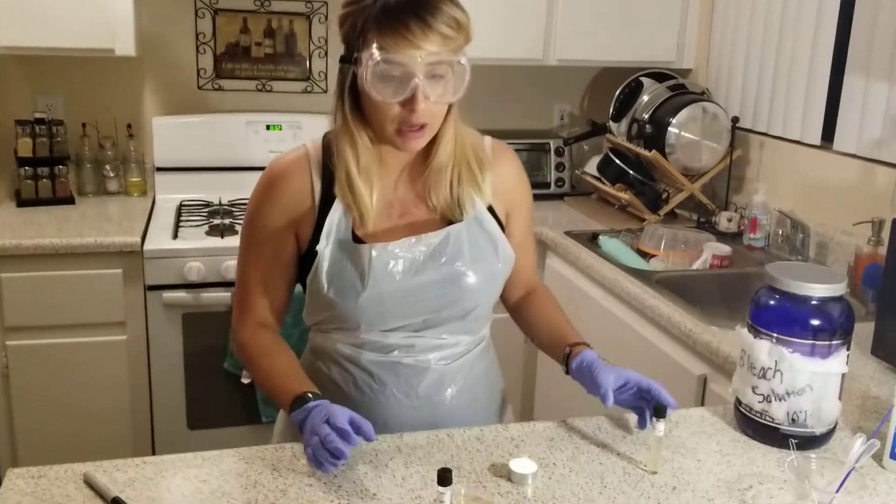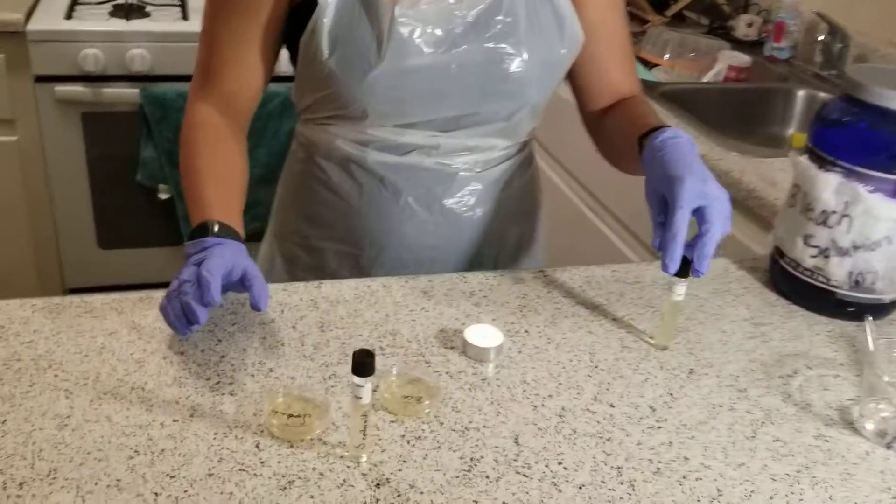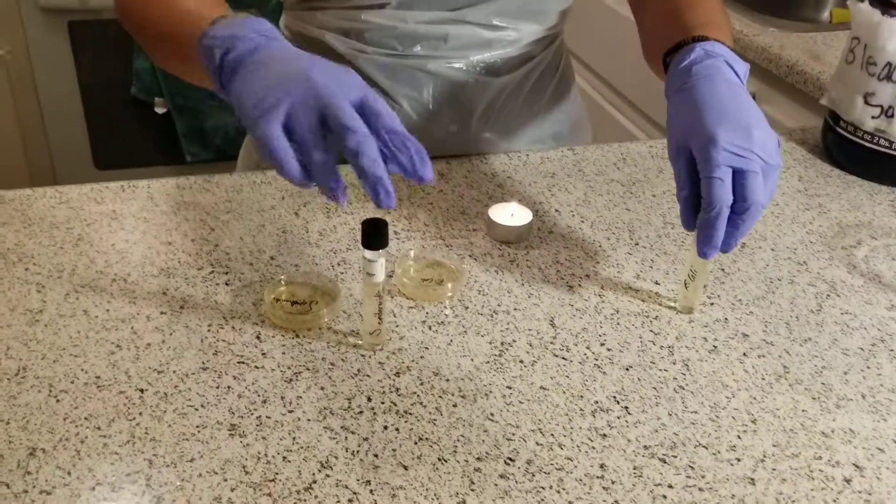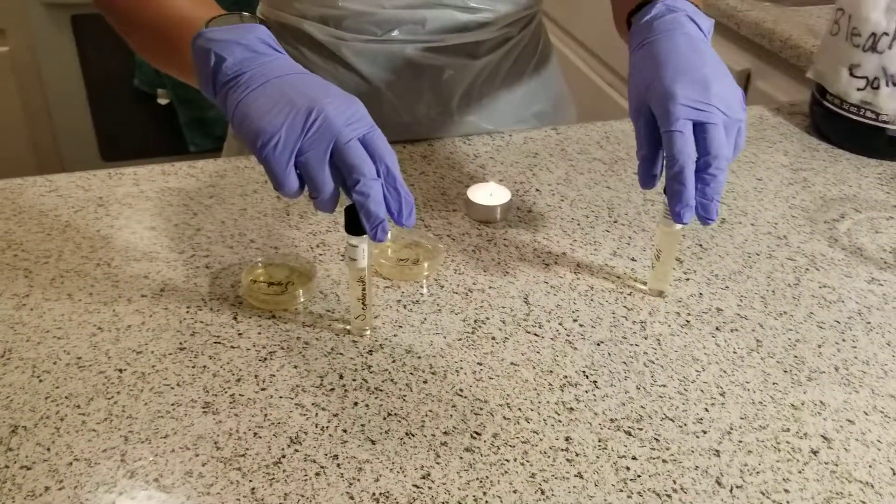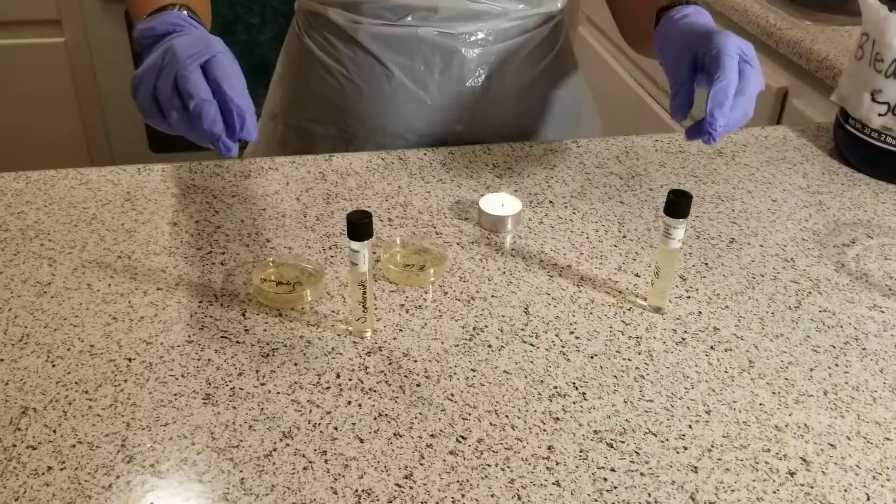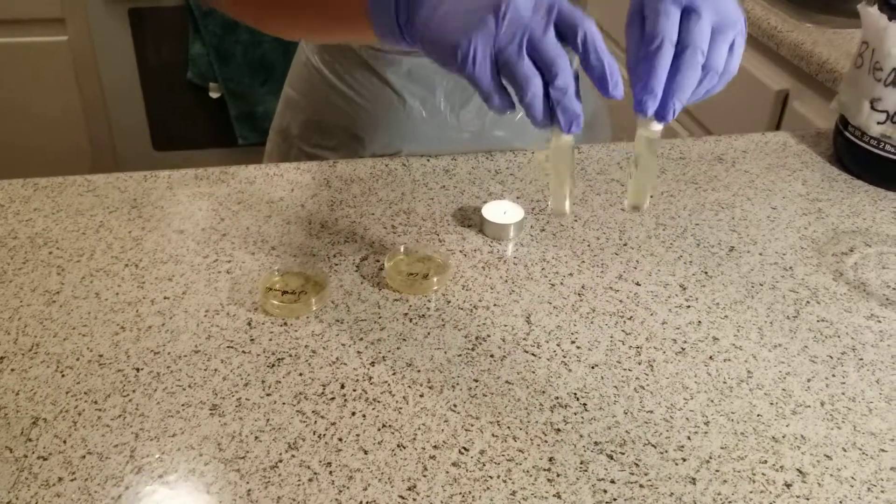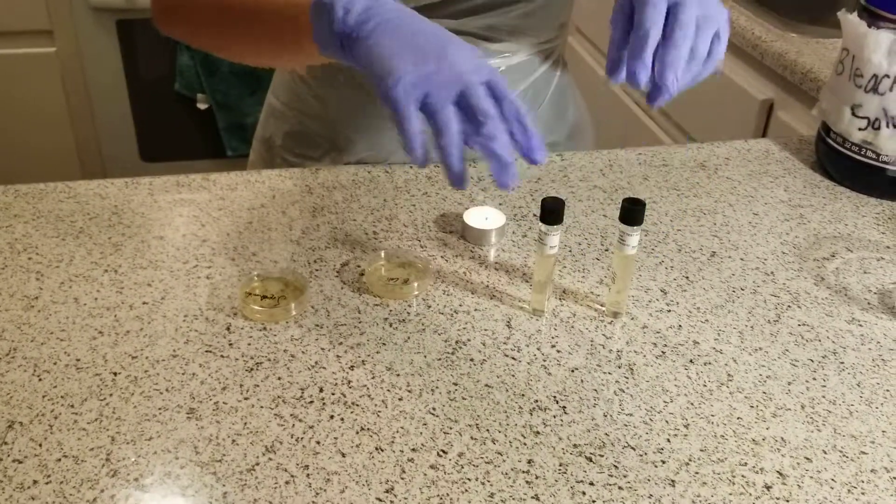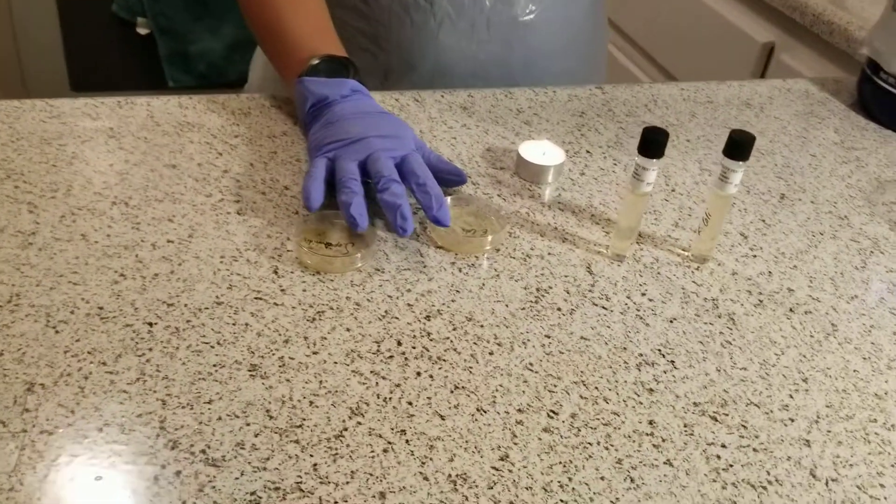In this lab, I will inoculate my cultures of E. coli and S. epidermidis in motility media. The motility media will determine if the bacteria are motile.